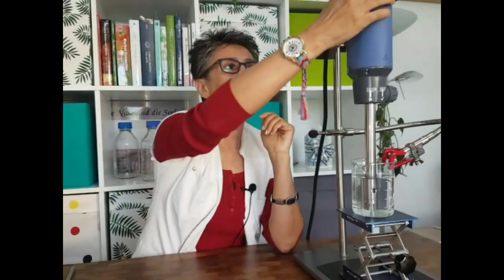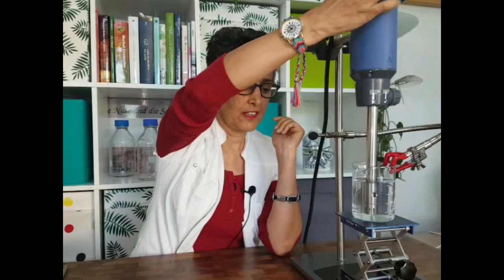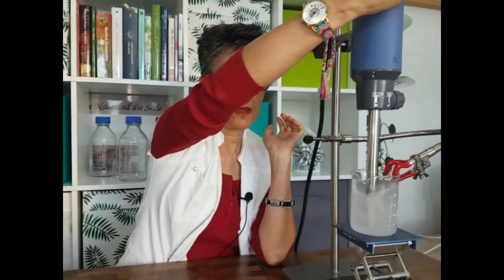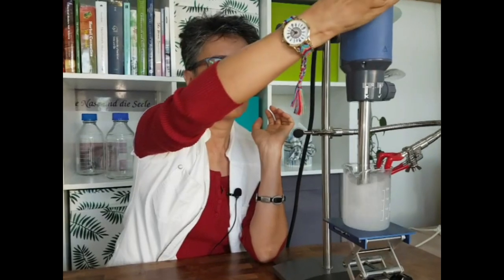A homogenizer has a rotor-stator mechanism and it has an axial motion. The motion is like this — it's not the rotation like the overhead stirrer.